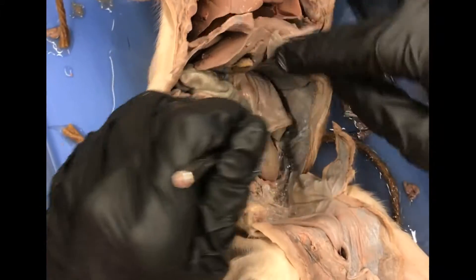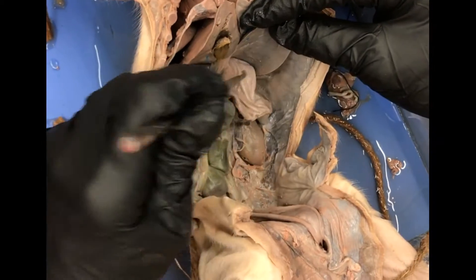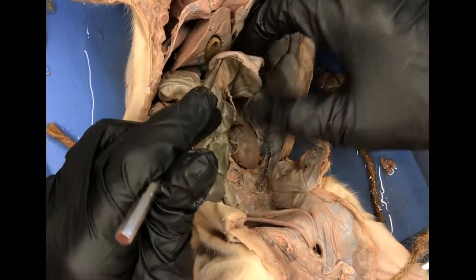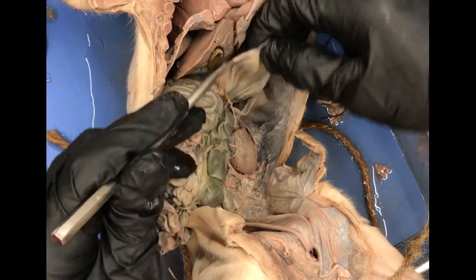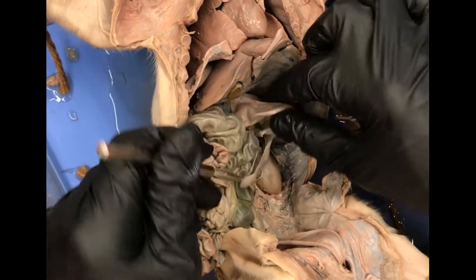Then you'll see another really large pouch here, and this is the stomach. It should be empty because this is a fetal pig, so there wasn't really any eating going on yet.